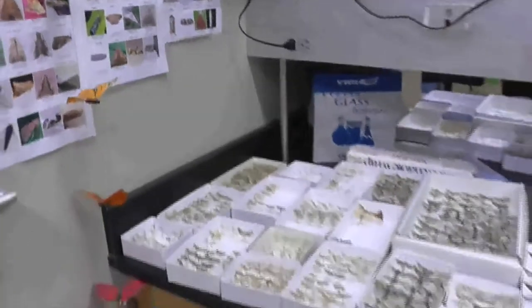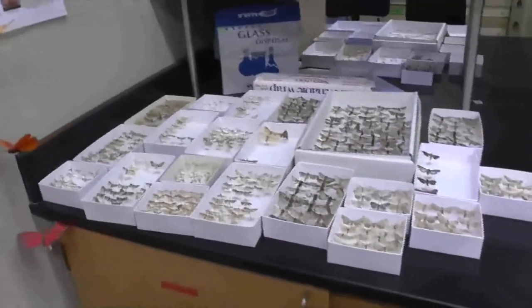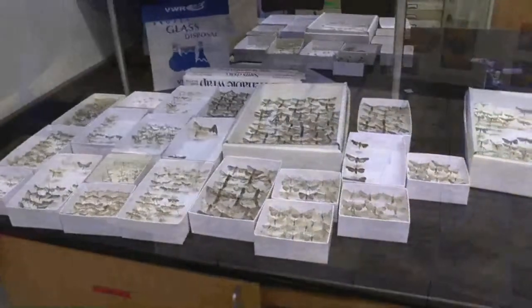In this video, I'm going to give you a rundown on the methodology of our phenology experiment and the process we go through before we can turn an unidentifiable moth into a useful data point sitting in our lab.